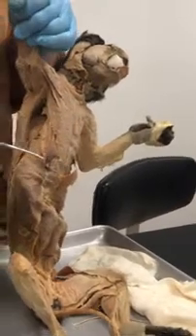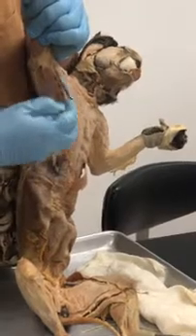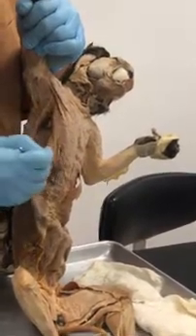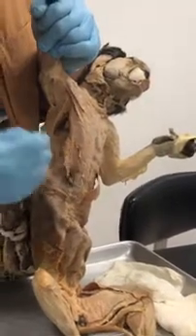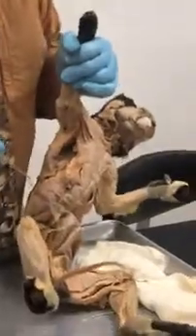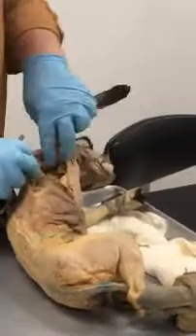And that's the xiphohumeralis. So again, pectoantebrachialis, pectoralis major, pectoralis minor, xiphohumeralis is this. Okay? Not too bad? Okay. Now, there's also a couple other ones I want you to know in here.